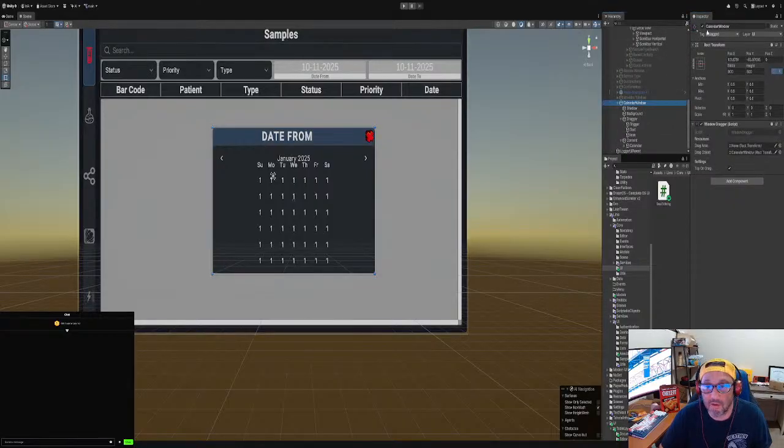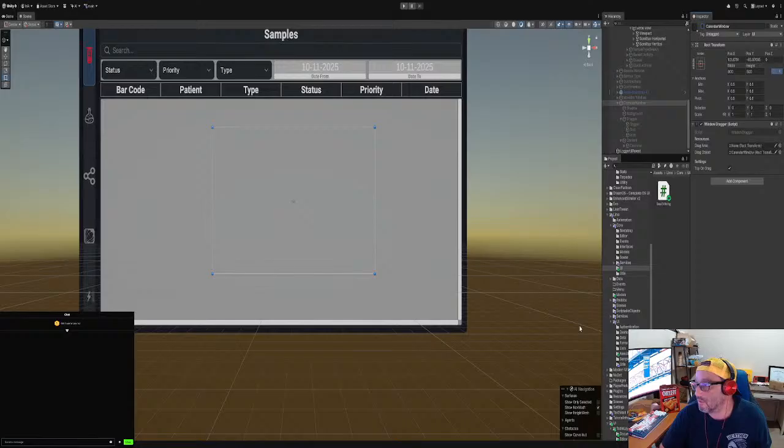So now we're pretending that we're doing a unit test, but we're gonna do a unit test almost end to end just for this portion. End to end is actually that. I'm just joking, but just for this portion. End to end on this context. How's that?